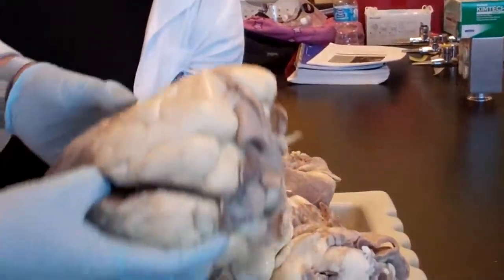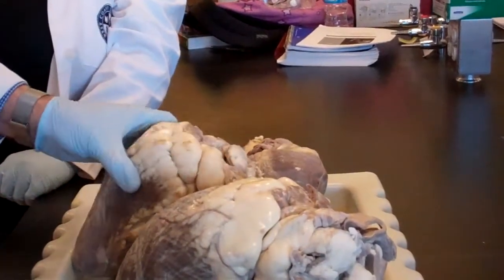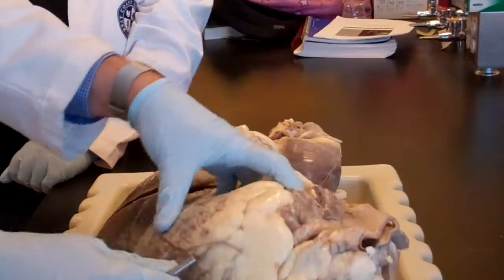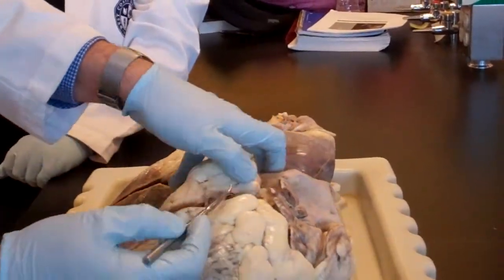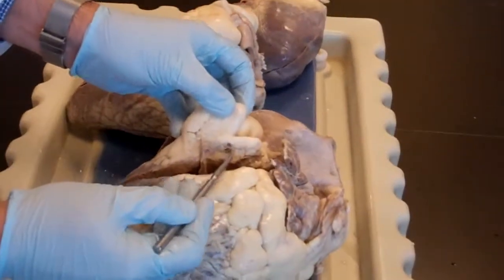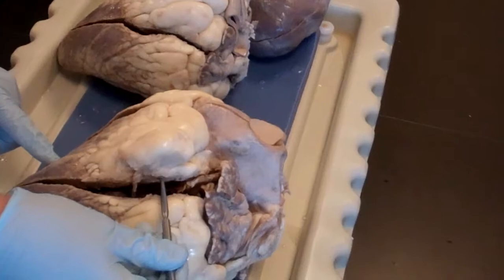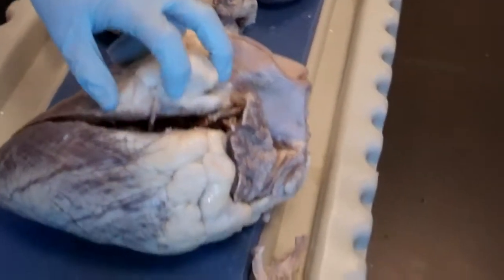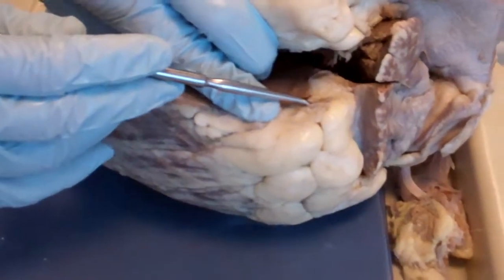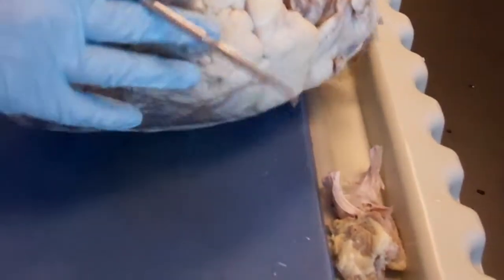And then, if you have a very thin and malleable probe and you want to play more, you can put it in the anterior interventricular sulcus because it has a big vein. You can try to manipulate your way from here. It is very clear right there. You cannot miss it. If you find your way, it's going to come out from here. So this is a cut off, and you can see the artery and the vein next to each other here. This is the artery that's holding itself, and the vein right next to it, squishy, very thin wall.